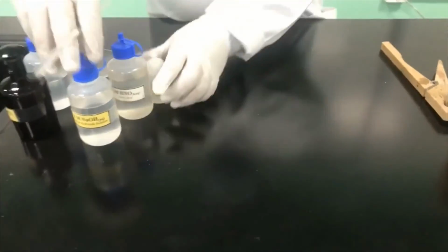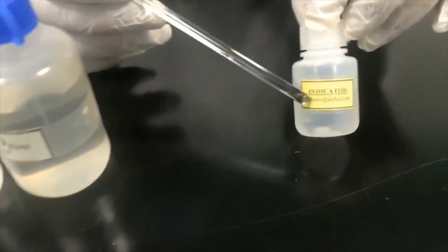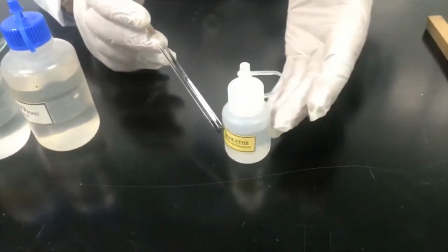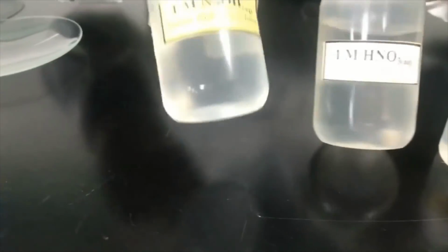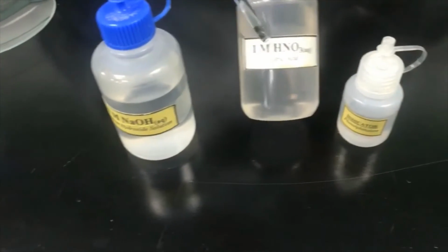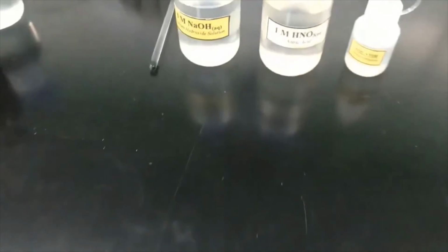Of course, you are going to see that this acid-base reaction will not produce a clear observation. Therefore, we have to use an indicator that will help us to get the observation. This is phenolphthalein indicator, and this will give you colorless in acid, and this will be pink in base. We are using two chemicals. One is sodium hydroxide. Of course, I'm going to use the acid, not the hydrochloric acid, but nitric acid. Let me show you the reaction now.